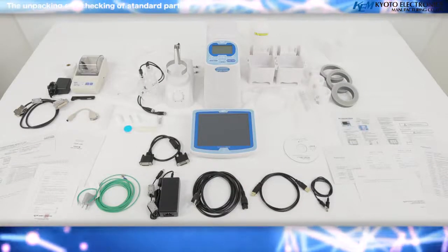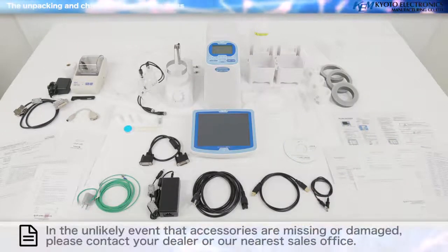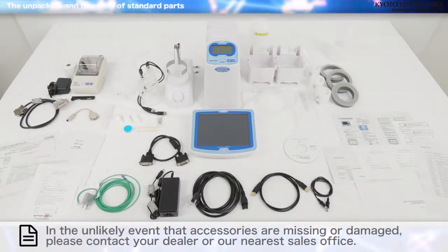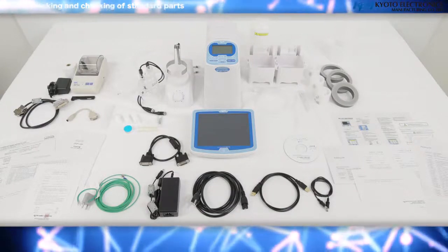Unpacking and checking of standard parts. The MKC710 unit, accessories, an instruction manual, etc. are included in the package. Please check that everything is present using the provided reference list.